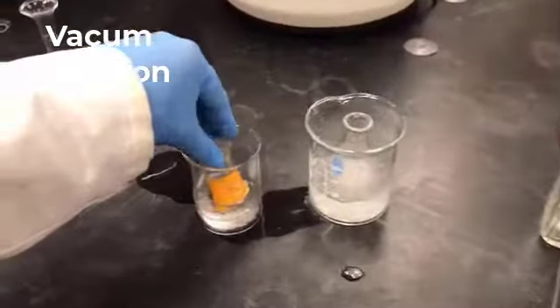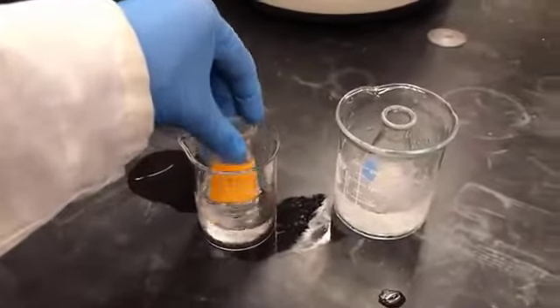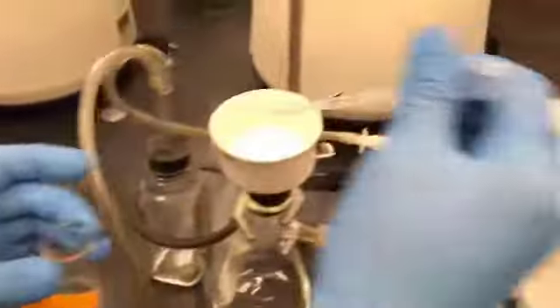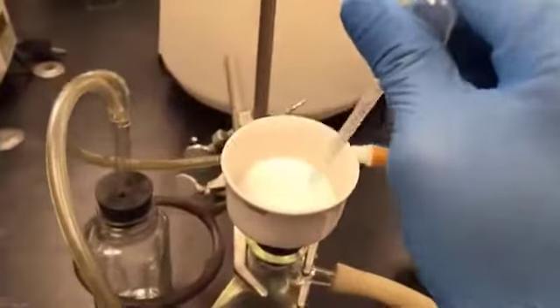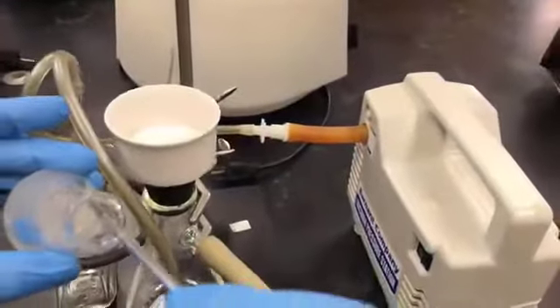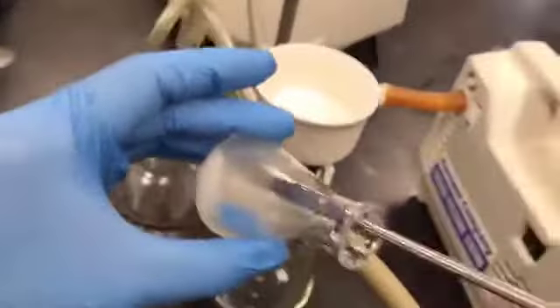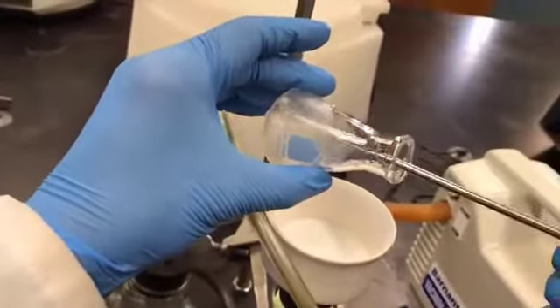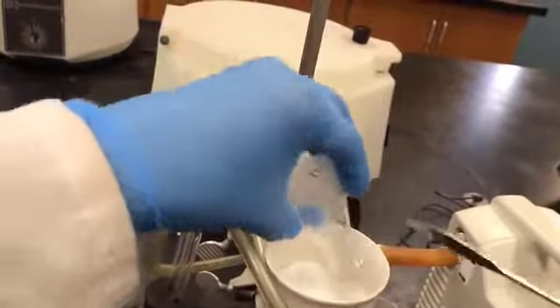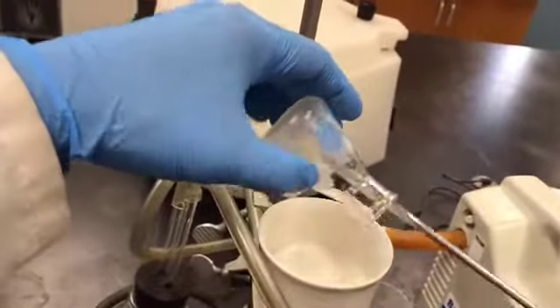I have kept another beaker, and it is the ice water bath. I have 95% ethanol. It is chilled 95% ethanol. Using this, I am going to wet my filter paper. The filter paper is wet. Now I am going to slowly remove the crystals slightly, and I'm going to transfer these crystals onto the Buchner funnel with the help of the spatula.